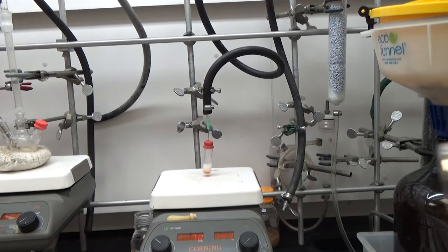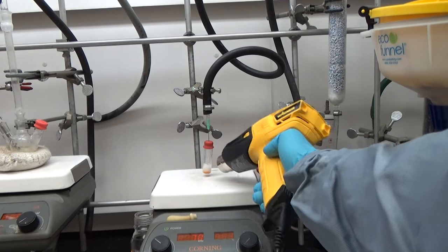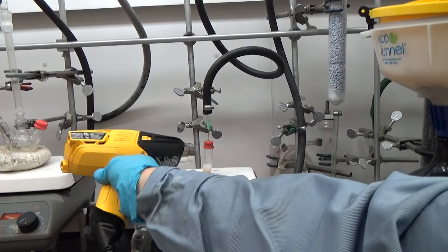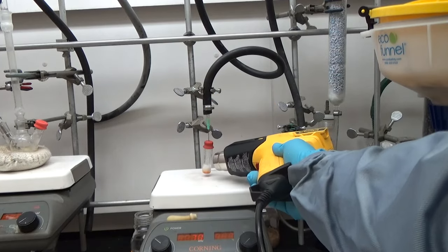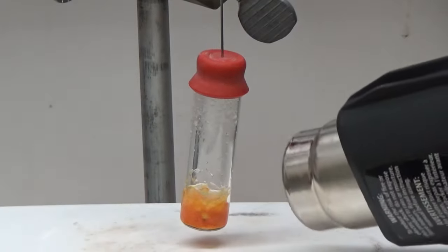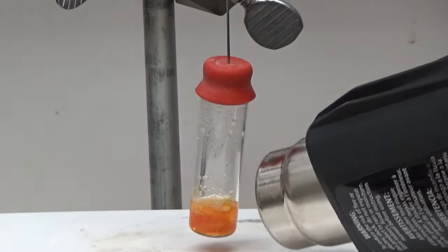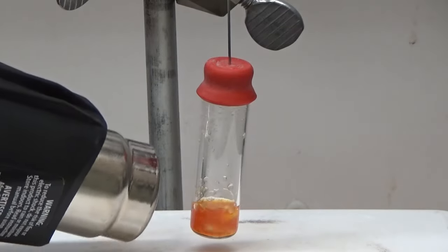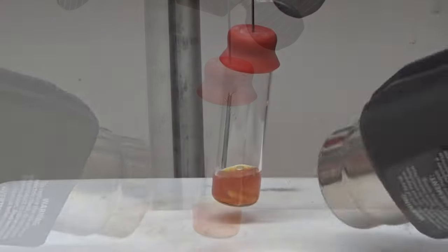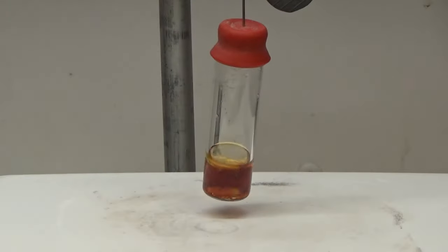So we just start to stir it and then put it under vacuum. And I'm not going to, I know I could be a little bit more careful. I just use a heat gun to melt the dodecylamine. The solution will degas pretty quickly. You can find publications on the chemistry of alkylamines and sulfur. You should be very careful when handling this. Alkylamines, they are readily absorbed through your skin and it's still a base. If you, especially if you have some allergies, this could do a lot of damage to your skin. So be very careful when handling alkylamines.